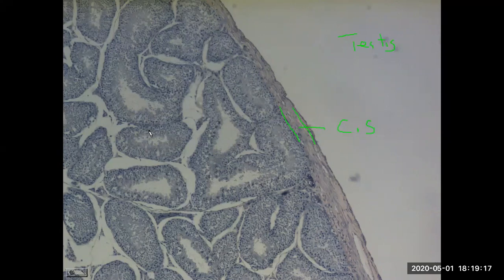And now we notice inside of the testes, we see these rings. So any of these open rings are seminiferous tubules. So that entire ring there, seminiferous tubule. And the spermatocytes, that's referring specifically to the sperm cells. And we can see those as the staining of the nuclei, essentially little dots. And the sperm cells develop in the wall of the seminiferous tubule. And they also move inwards towards the lumen. So truly just the nucleus represented here. That would be the nucleus of a spermatocyte in some stage of development.